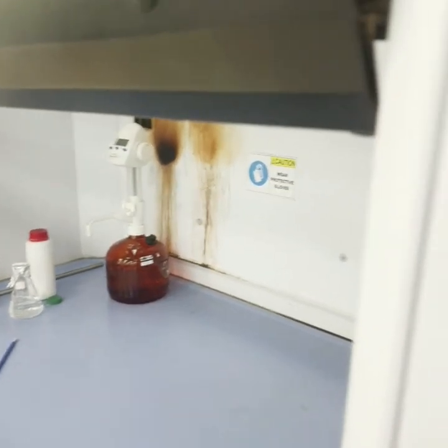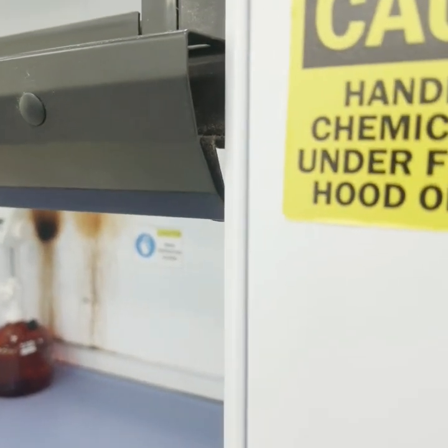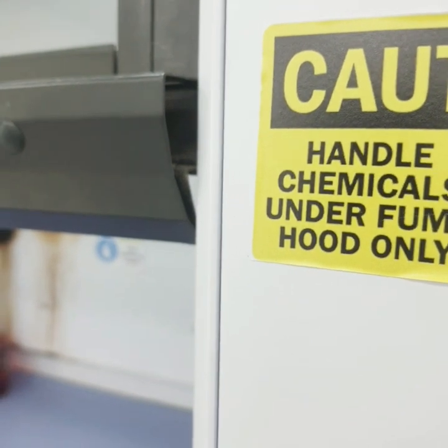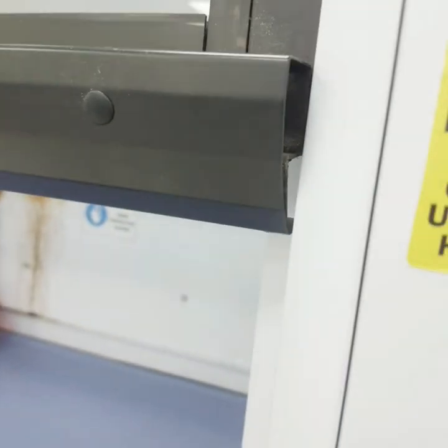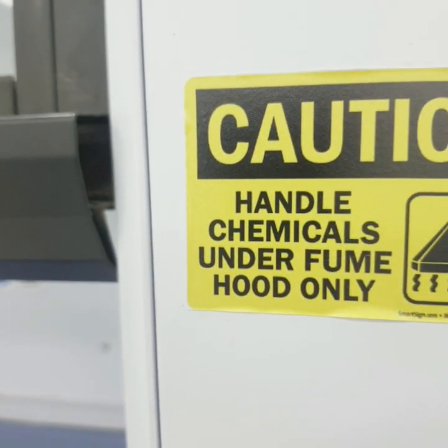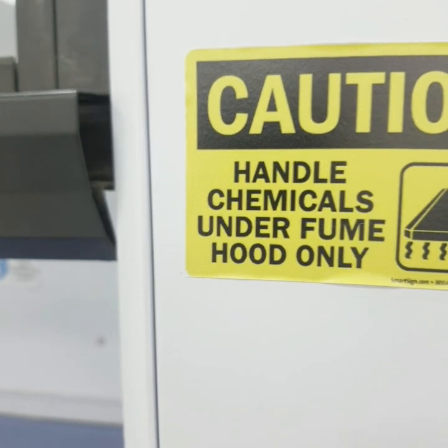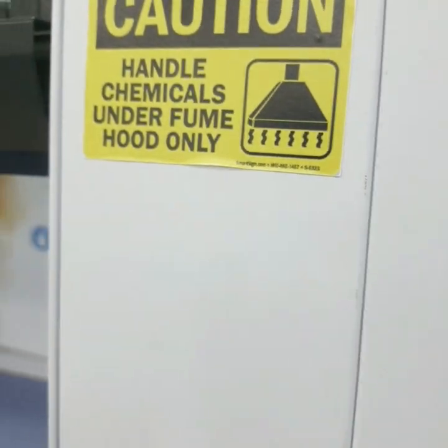As per OSHA, the general airflow should not be turbulent and should be relatively uniform throughout the laboratory, with no high-velocity or stagnant areas. Airflow into and within the hood should not be excessively turbulent, and hood face velocity should be adequate — from 60 to 100 fpm.